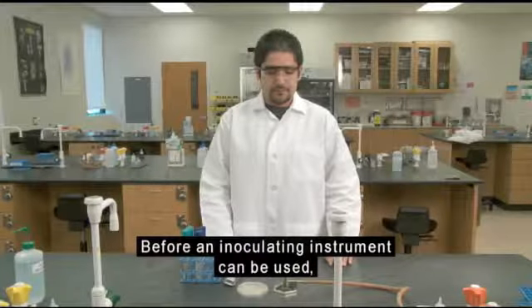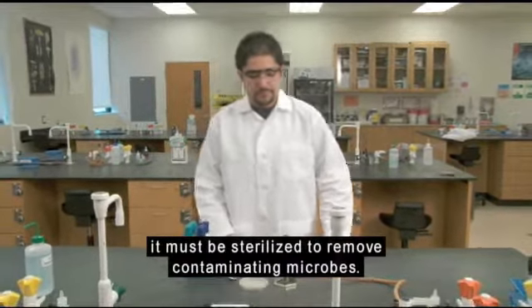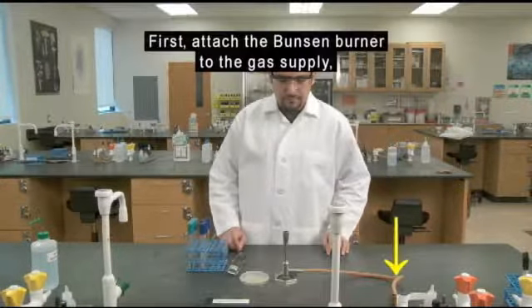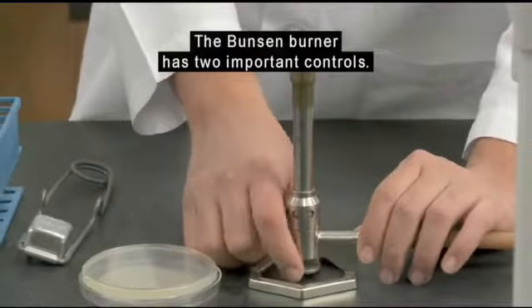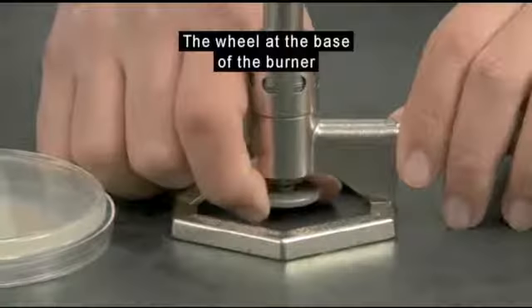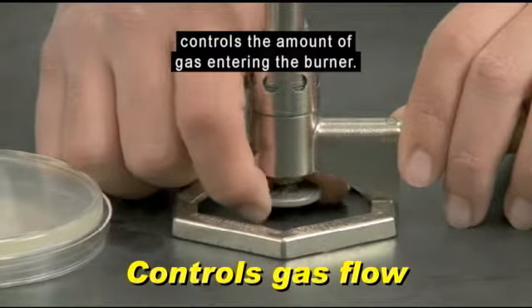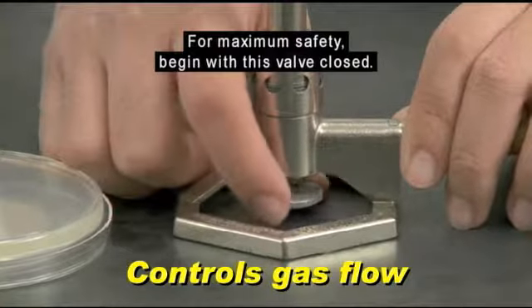Before an inoculating instrument can be used, it must be sterilized to remove contaminating microbes. We'll do that with a Bunsen burner. First, attach the Bunsen burner to the gas supply, making sure the tubing fits snugly around the gas nozzle. The Bunsen burner has two important controls. The wheel at the base of the burner controls the amount of gas entering the burner. For maximum safety, begin with this valve closed.